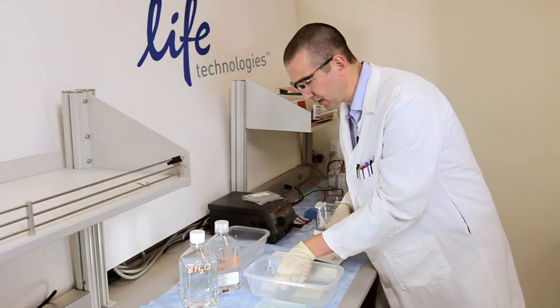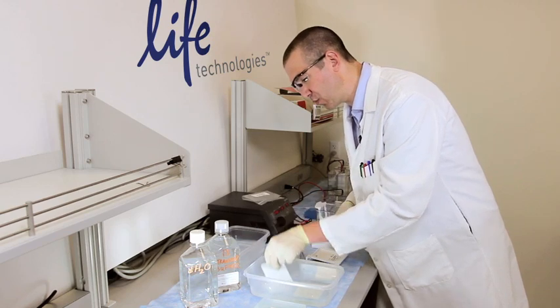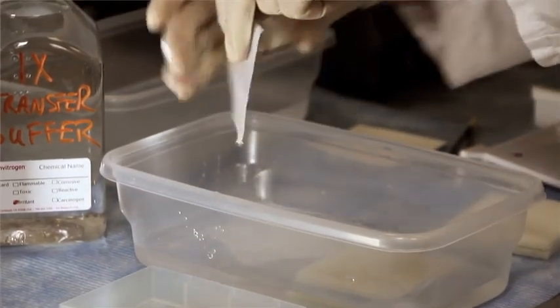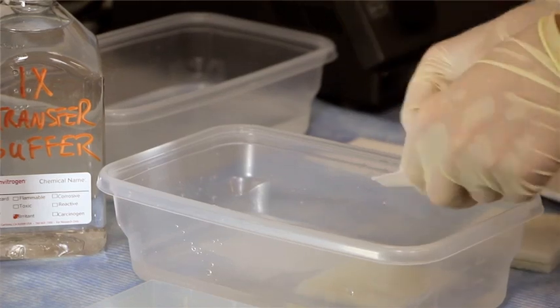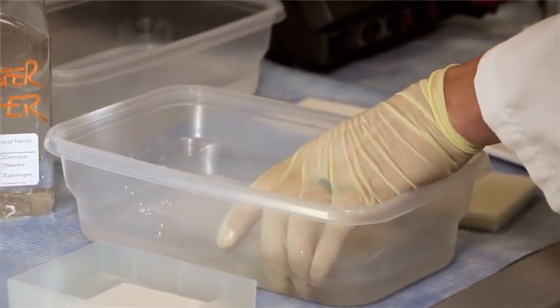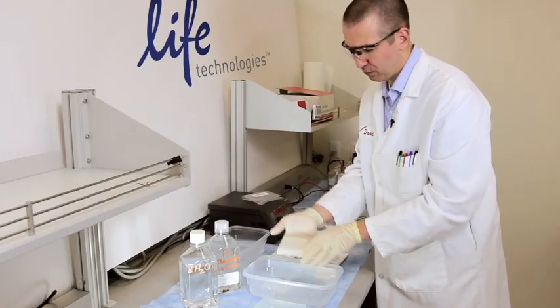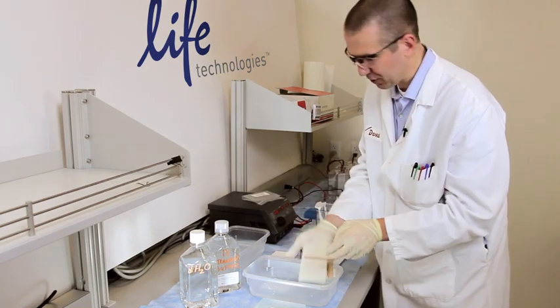Now what I'm going to do here is take one of the pre-wetted filter papers and put it on top of the two pre-wetted sponges.